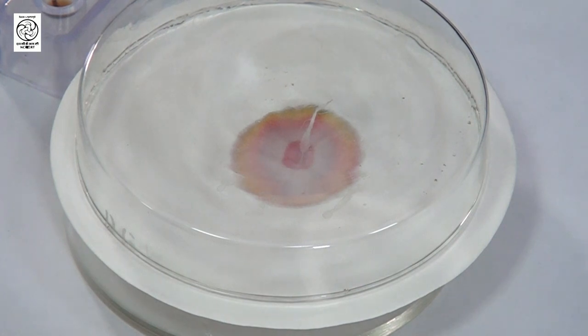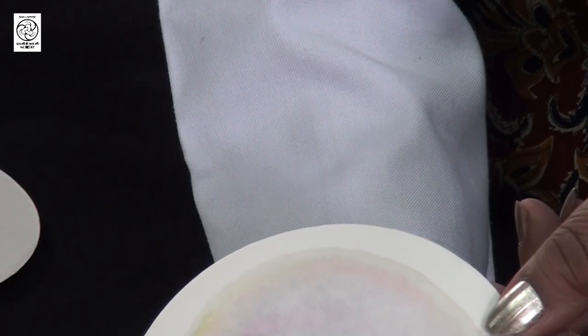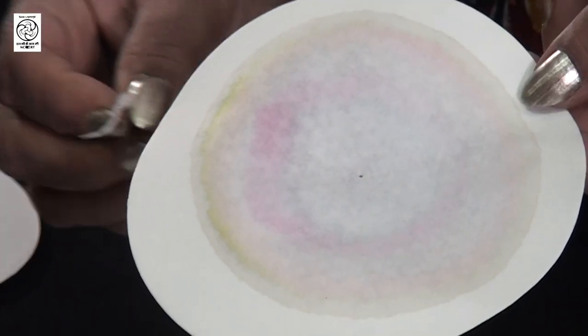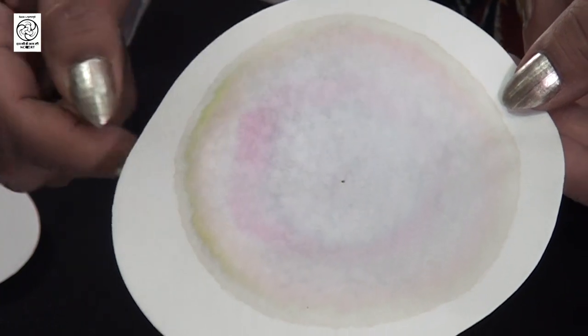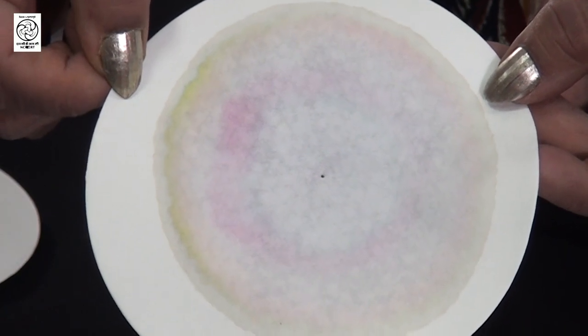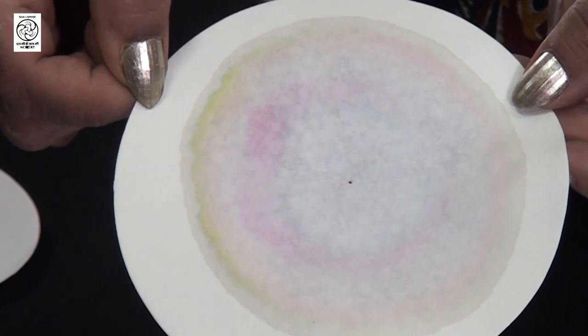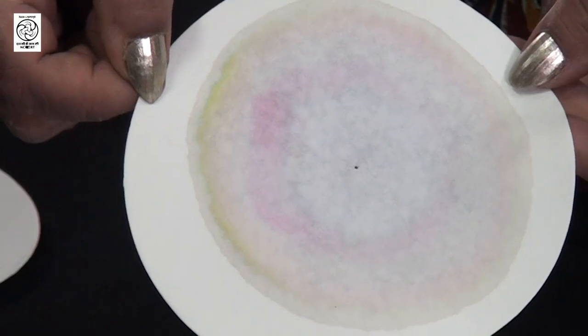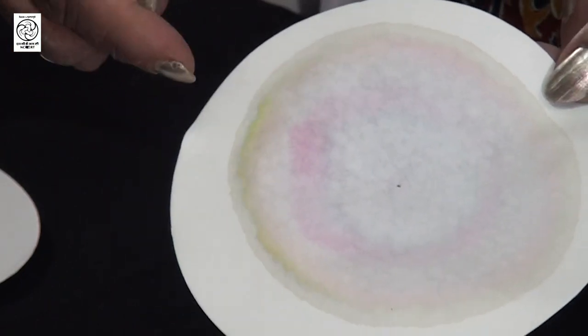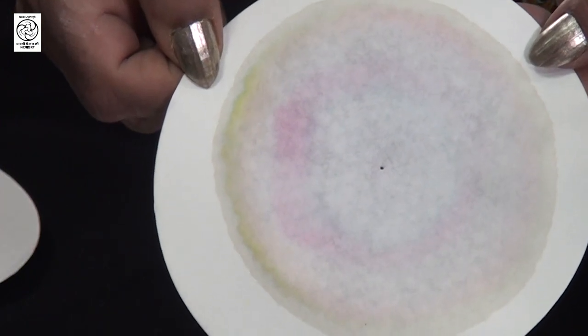Just keep observing this filter paper — you will see that the solvent starts moving. We have now taken this filter paper out and removed the wick. You can see there is a clear separation of different colours, meaning different coloured compounds have separated by paper chromatography. You can see different rings: one is pink coloured, inside there is a bluish colour, and the outer rim is a mix of greenish and brown colour. The pink and the green-blue are very clearly separated by this technique.